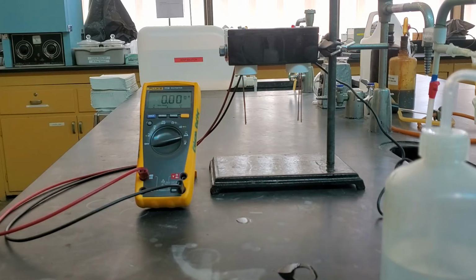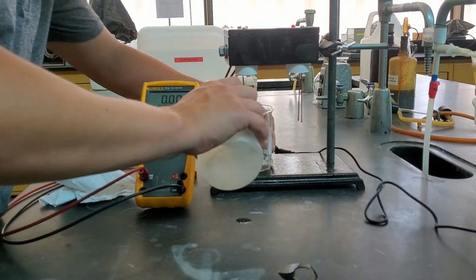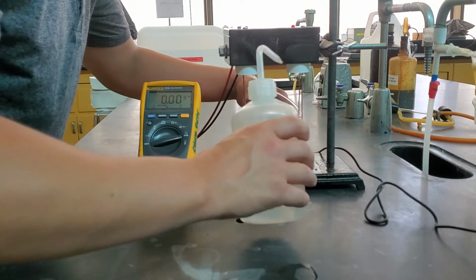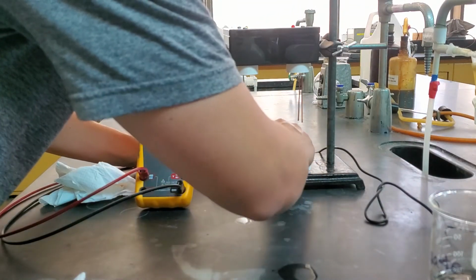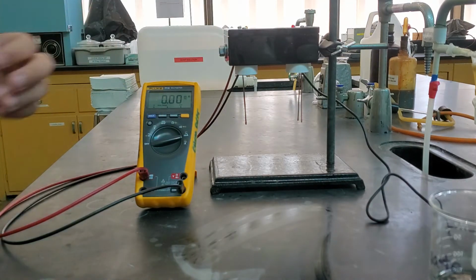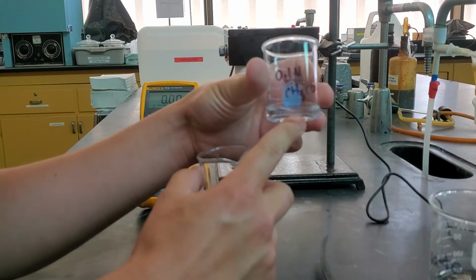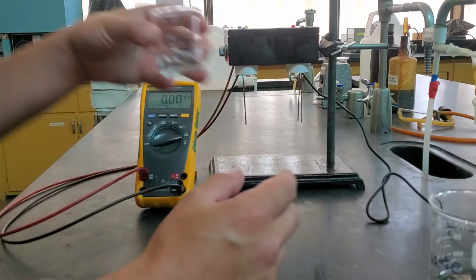And so that's our 0.01 molarity NaOH and our 0.01 molarity HCl. Gotta clean those off. A little bit of a change, not a huge change though. I'm gonna wipe up this water that spilled out of the beaker there. Plug this back in, and so now we're going to move on to the second set. This is a similar amount of materials as well, about 6 milliliters. So this is 0.1 molarity acetic acid, CH3COOH, and 0.1 molarity NH3.